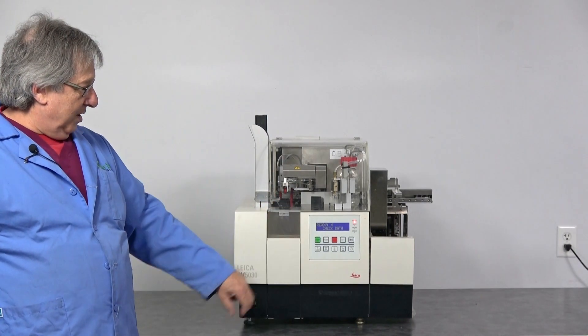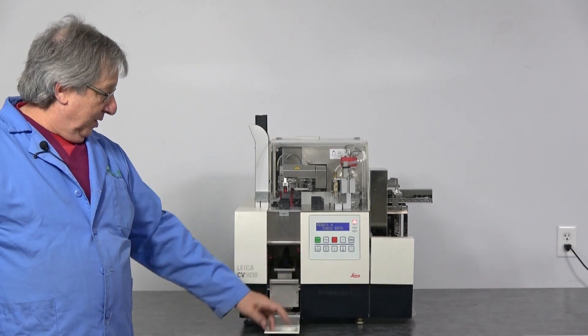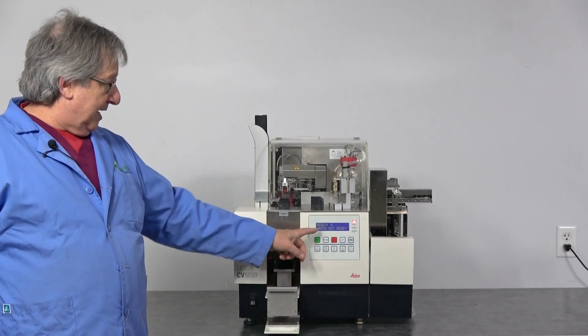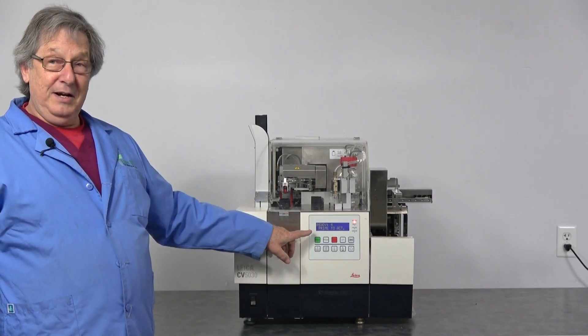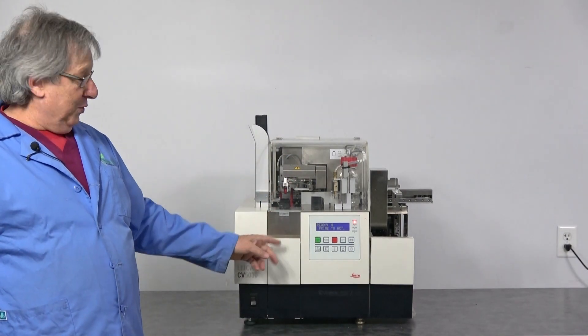When you turn this on, the first thing you have to do is open the door, check the bath, and now it's ready to prime. I didn't do anything. I just opened the door and touched it.